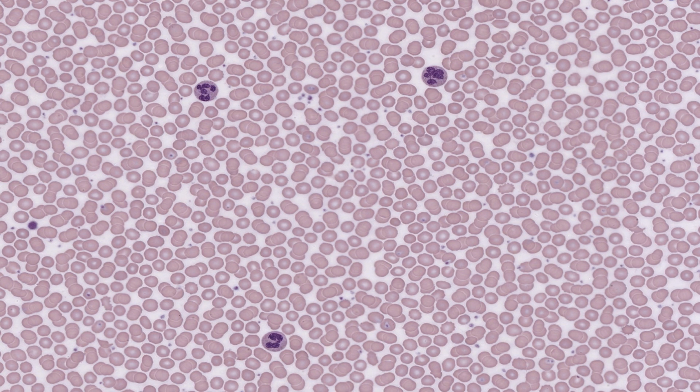Another very interesting feature of neutrophils is that they can show whether a blood sample is from a male or female person. Females have 2 copies of the X chromosome. Males have only one X chromosome plus a minute Y chromosome. The second X chromosome of a female is heterochromatic. That is, it's highly compacted, darkly staining, and genetically silent.